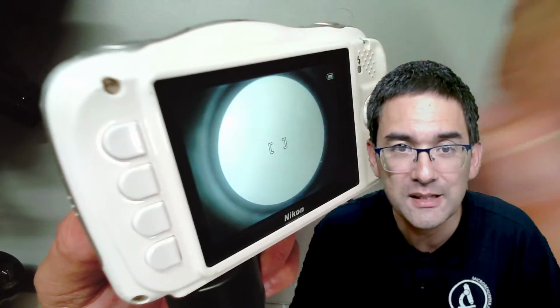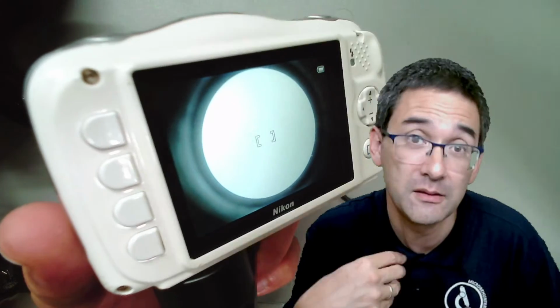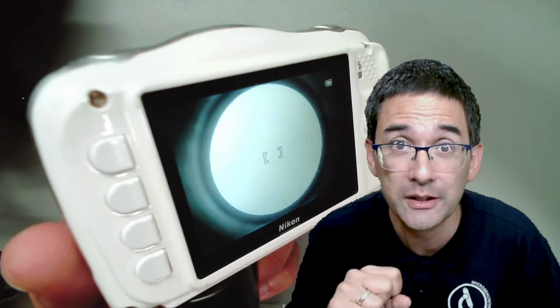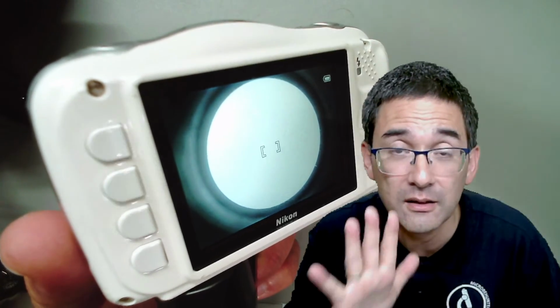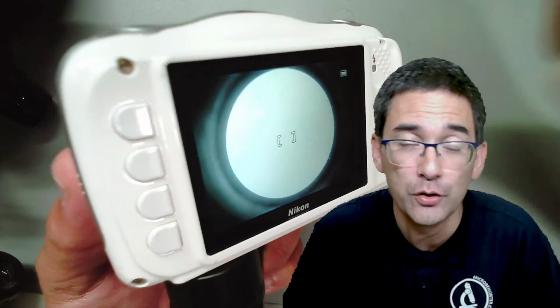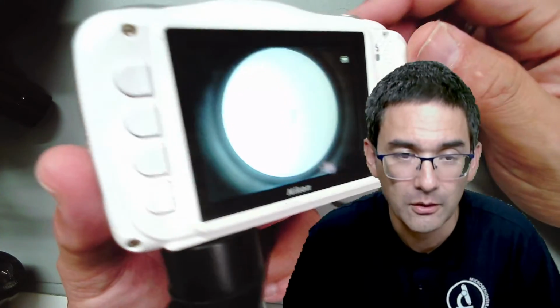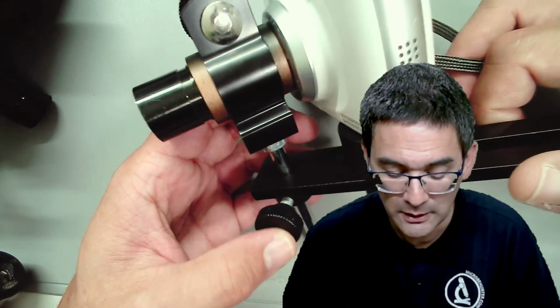So this is a disadvantage with some of those cameras. Mobile phones allow you, at least the Android system that I have, and I'm also sure that the iPhone does it as well, to lock the focus so that once it's focused, it does not change anymore, even if you change the focus of the microscope.